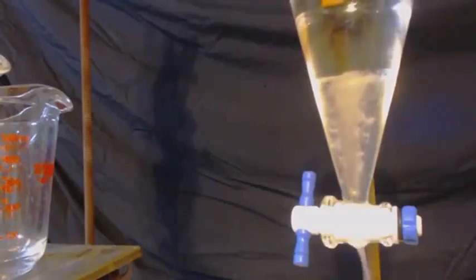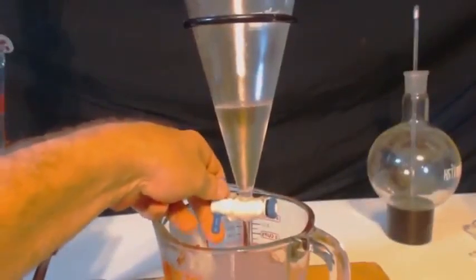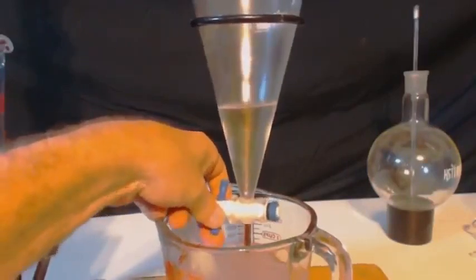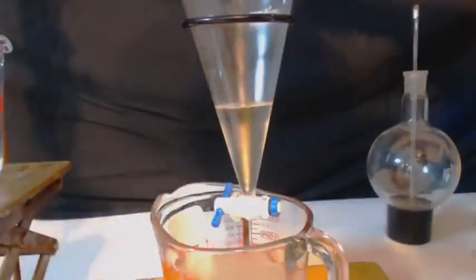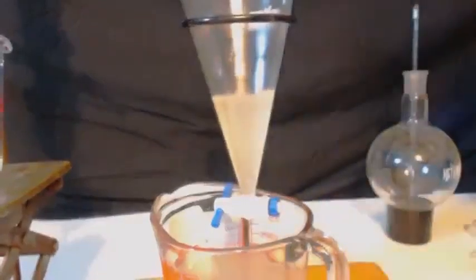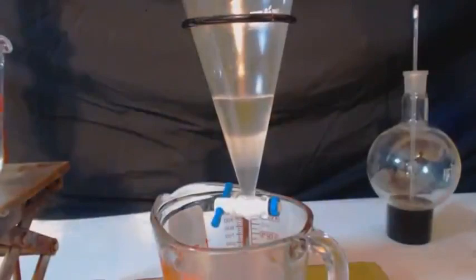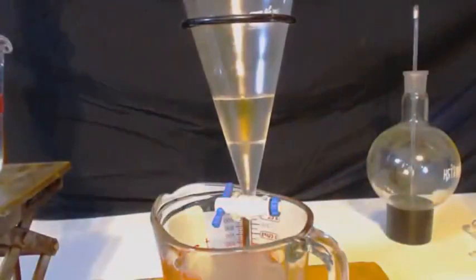I'm going to clean this out twice with the water, just to make sure, because one washing is definitely not going to take all the acetone out of there. So this is the first washing here, and I'm going to add this next washing. I'm only putting like a couple milliliters of water in here, and yet when the two layers form, the bottom layer is going to be giant compared to what I'm putting in there.